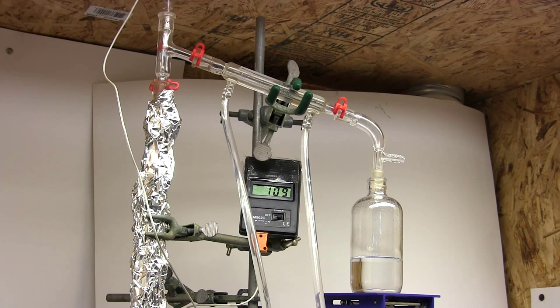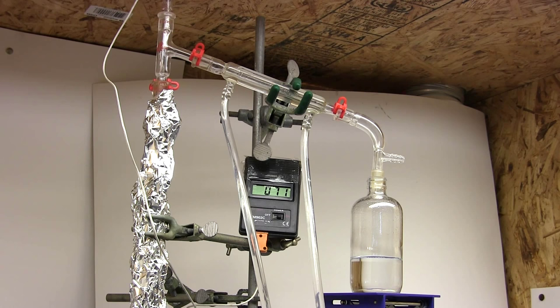But who knows, maybe I'll build one if I can assemble the right parts. And we are done. Despite not getting good separation of the methyl ethyl ketone, the insulated column still let us improve separation of toluene from fraction two.